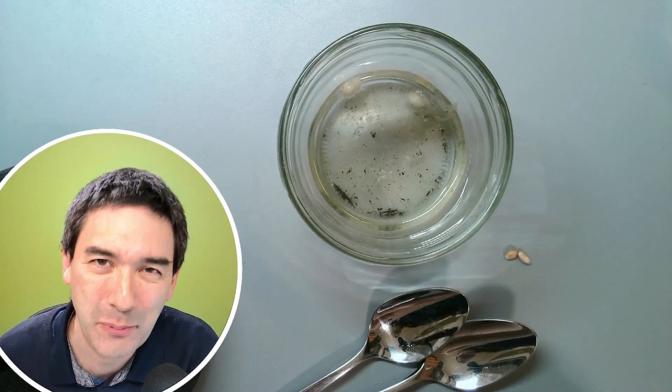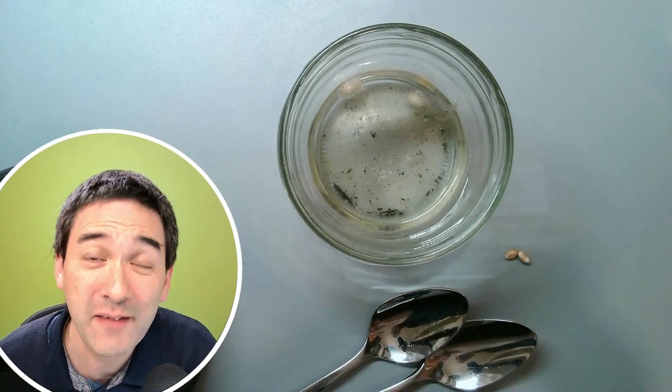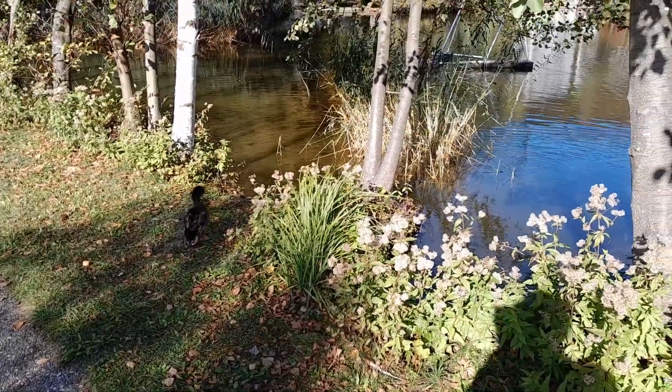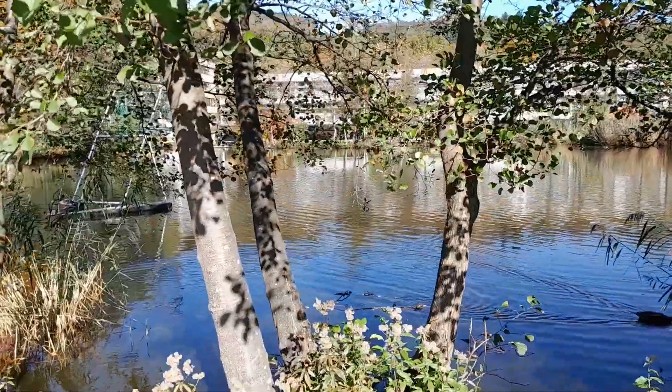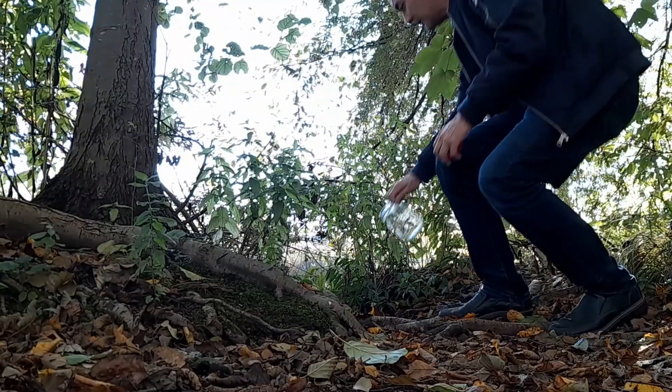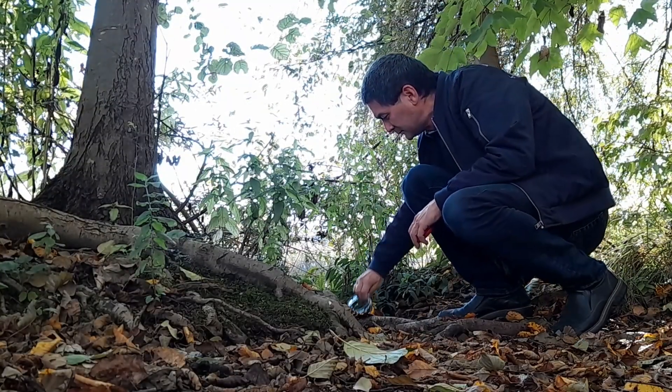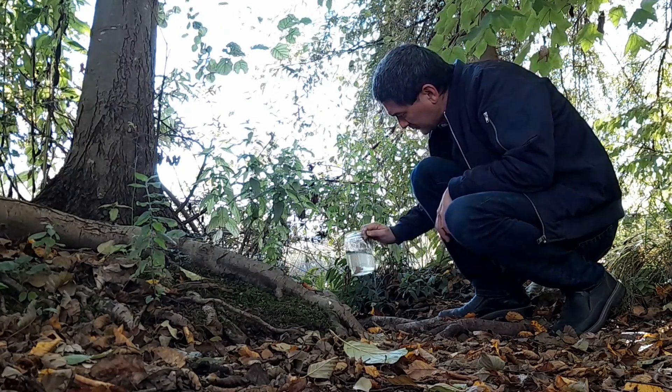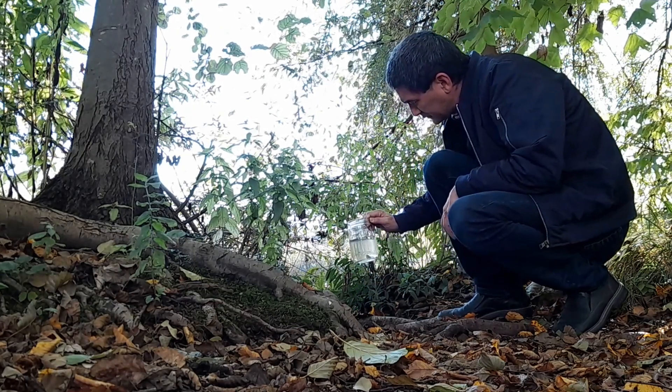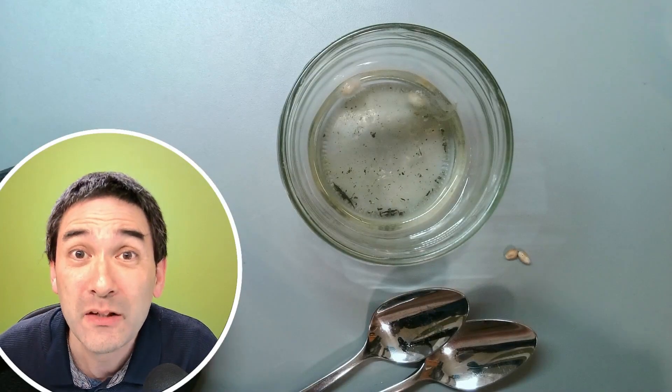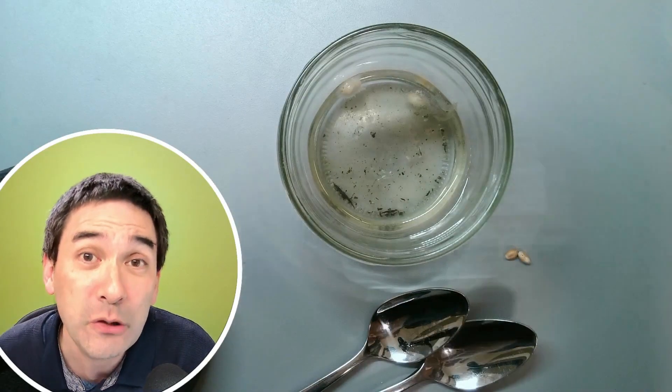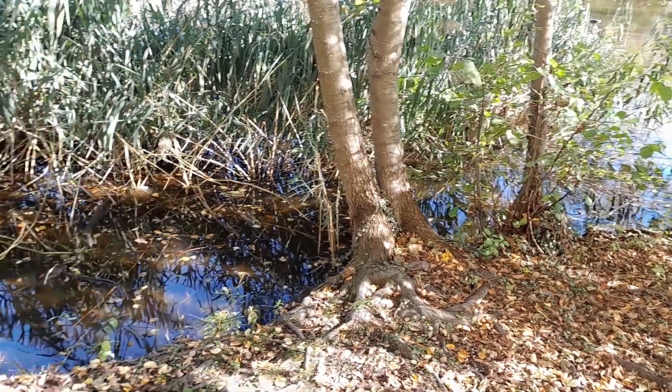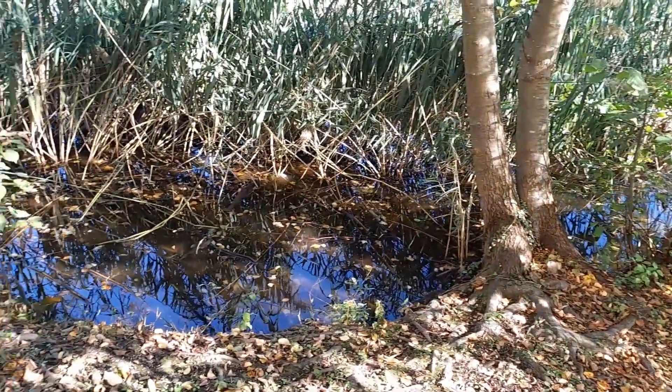So hi, hello and welcome again. Microbe Hunter here. A few days ago, I visited a local pond to collect a water sample for microscopy. One of the problems when collecting pond water is that even though there are many interesting microorganisms present—algae, bacteria, ciliates, paramecia, water fleas—generally they are at a fairly low concentration, at least in my opinion, too low to be interesting for microscopic observation.